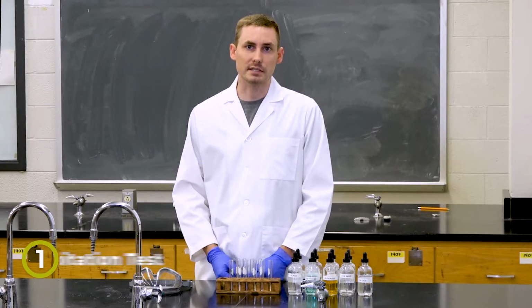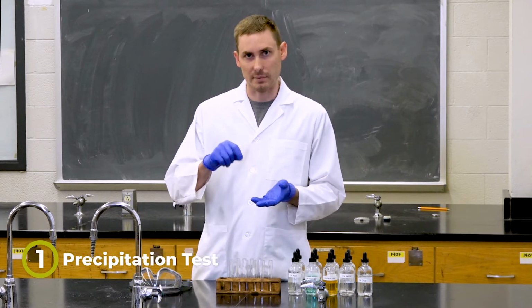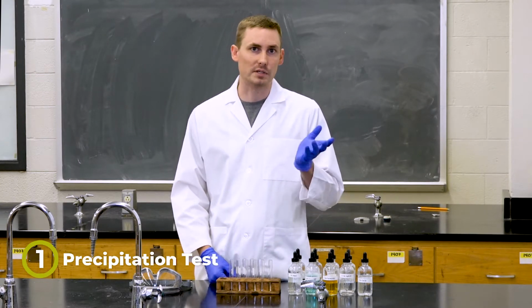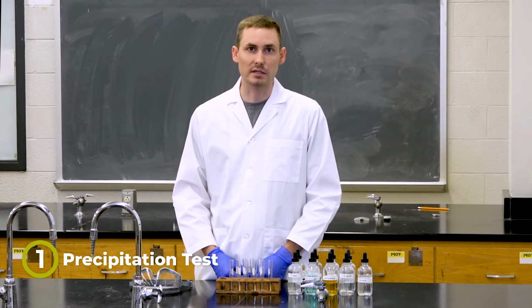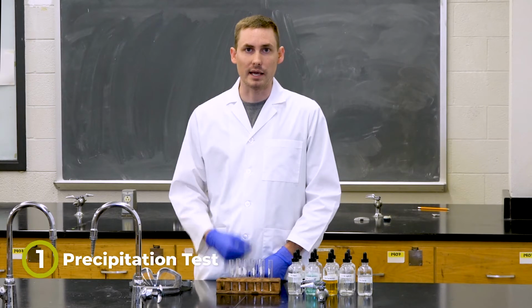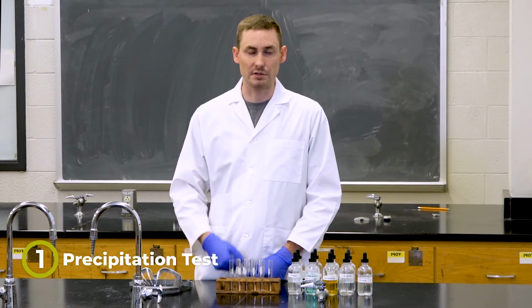There are three types of qualitative tests that we're going to be doing today. The first is a precipitation test. A precipitation test is a test wherein we have an analyte in solution, we add a chemical, and then a white or some colored precipitate will form. A precipitate is a solid that forms in solution, and it will eventually, if left alone, fall to the bottom of the test tube as a solid.